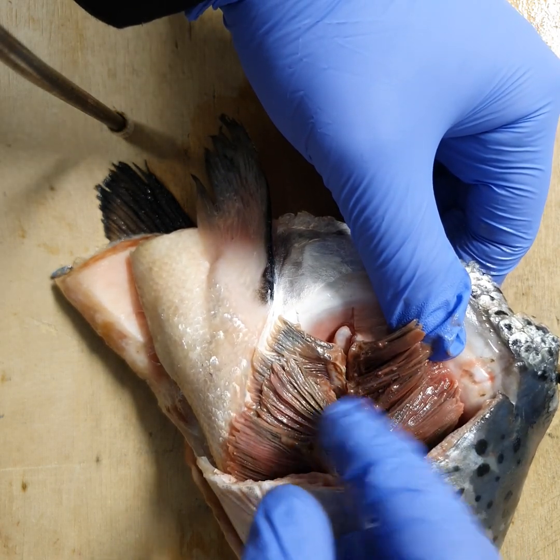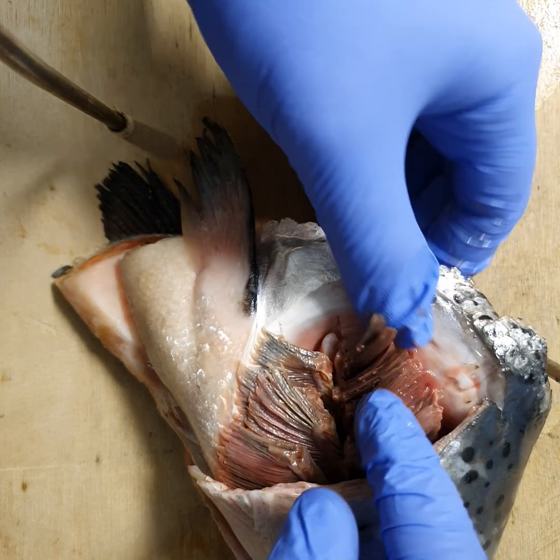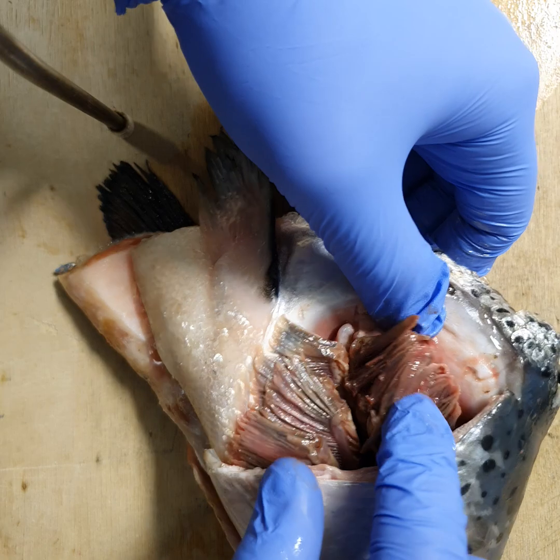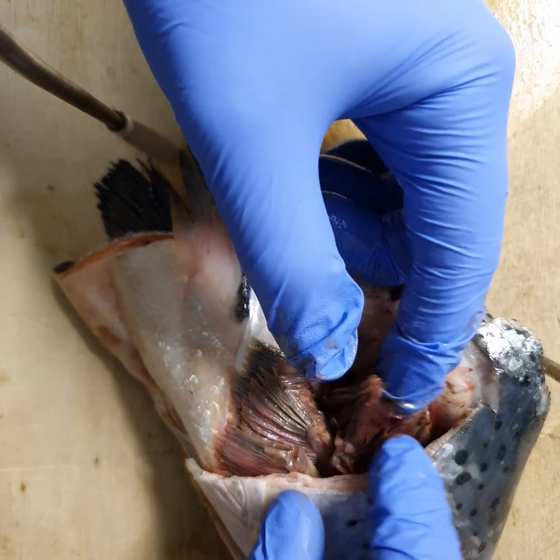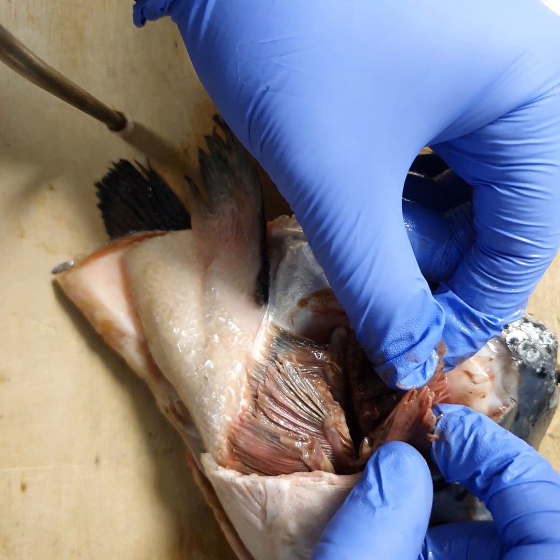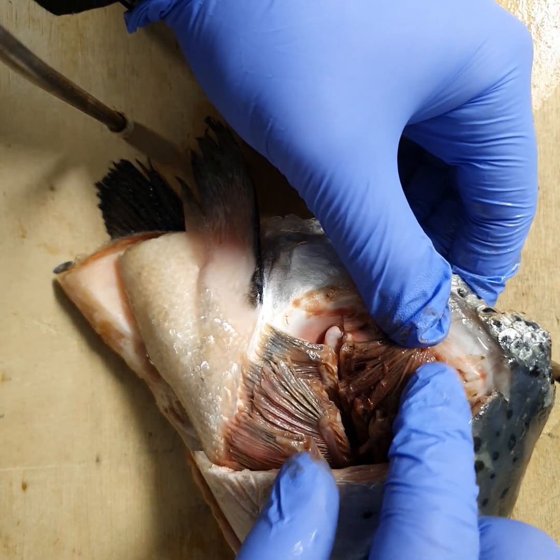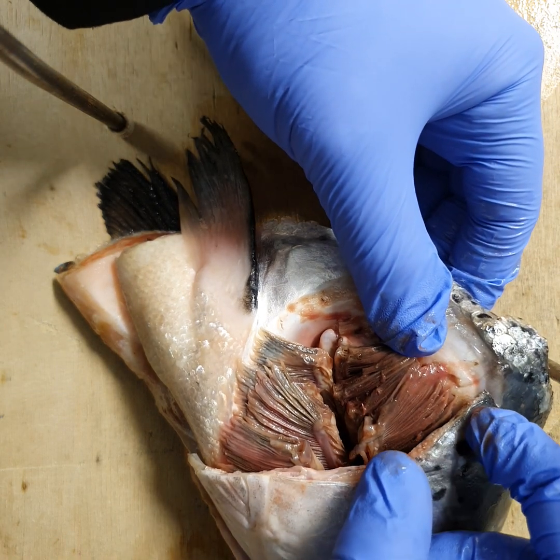A large surface area is one of the key adaptations of an efficient gas exchange system — namely oxygen in and carbon dioxide out. What we cannot see with the naked eye, or without the aid of microscopes, are the lamellae. The lamellae are microscopic structures on the filaments which further increase the surface area.